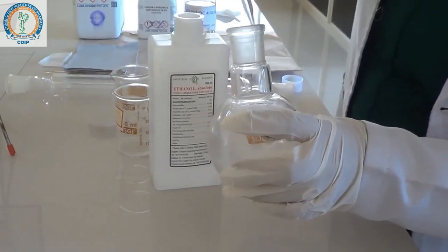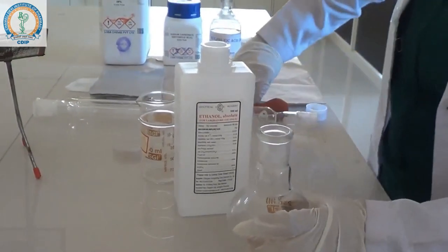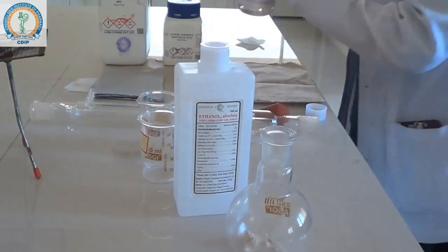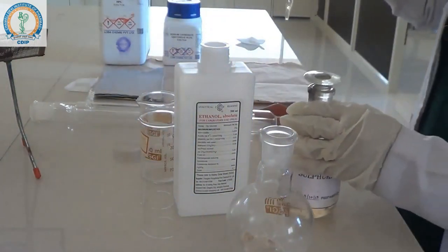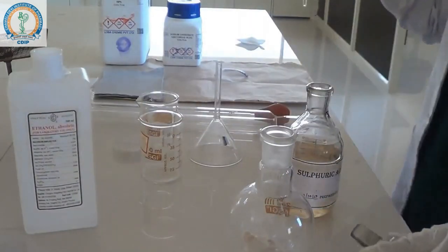After that, add 0.5 ml of concentrated H2SO4, concentrated sulfuric acid.